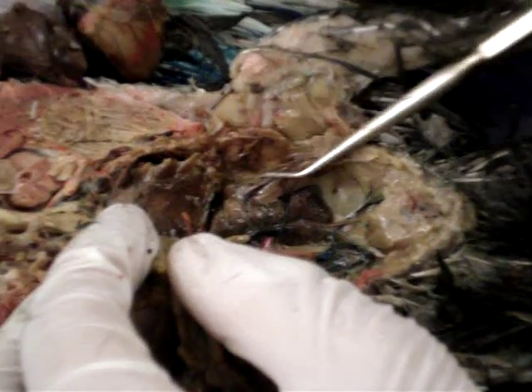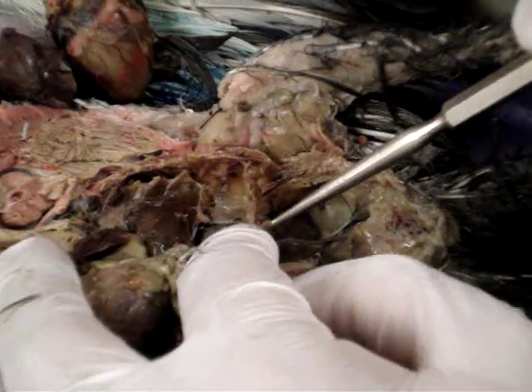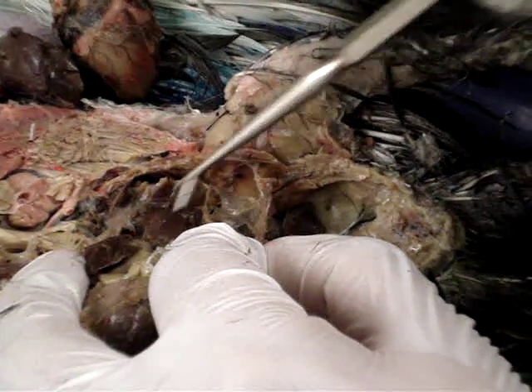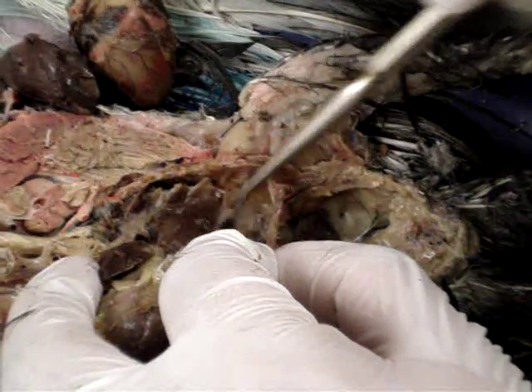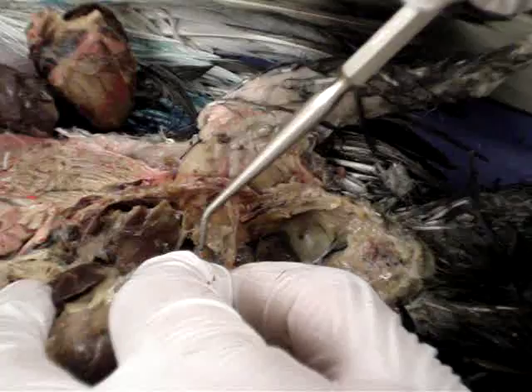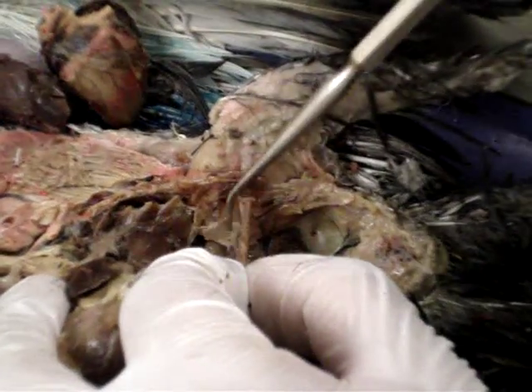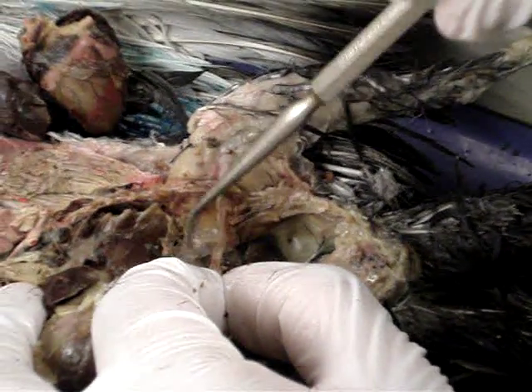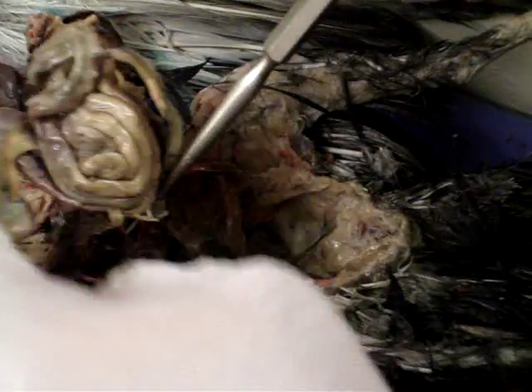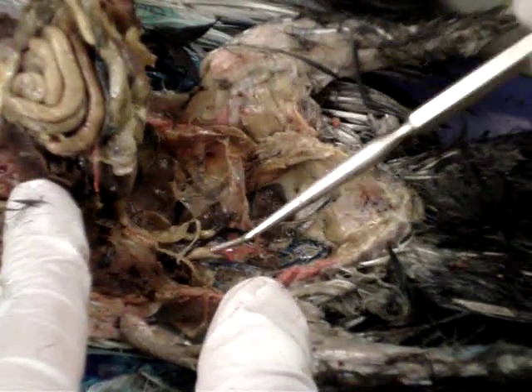Air sac. Can't see it now, but the air sac was a small membrane which is part of this — part of this membrane that was in this section right here. The bird was dead so it wasn't filled. When I pulled on it you could see there was a cavity. On the other bird at the other table you can see this much better. We've already opened this up quite a bit, but there you can see the other lung and the remnants of the air sac.